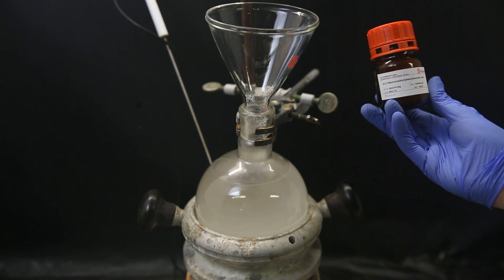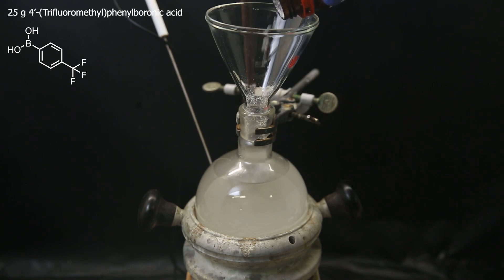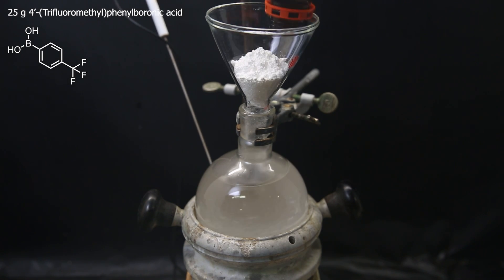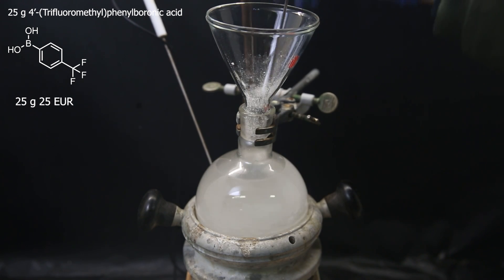Then the next reagent is the whole bottle, which is 25 grams of 4-trifluoromethyl phenylboronic acid, which was also decently priced. As the base, I use 53 grams of sodium carbonate.